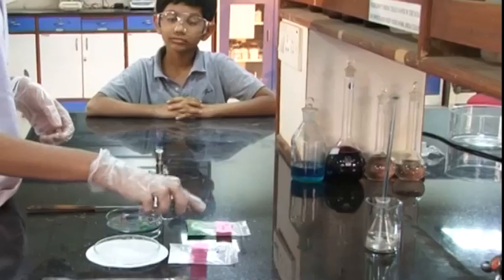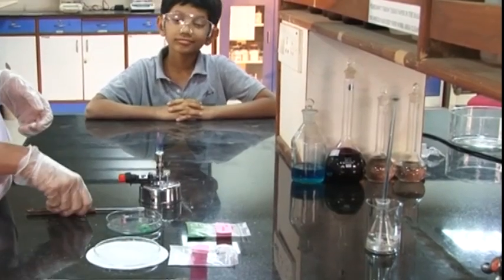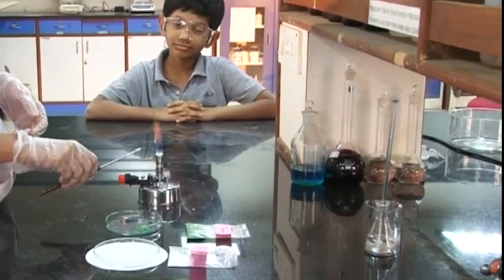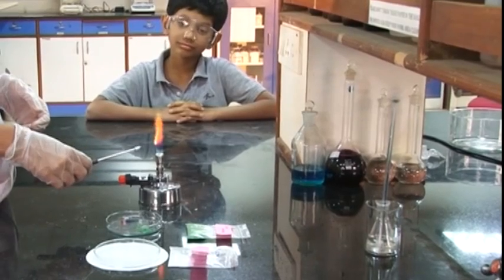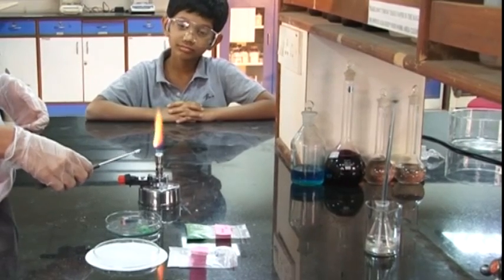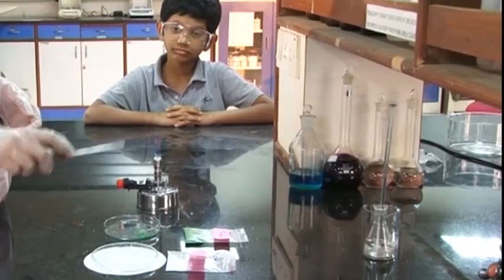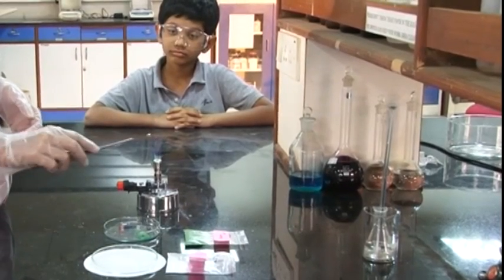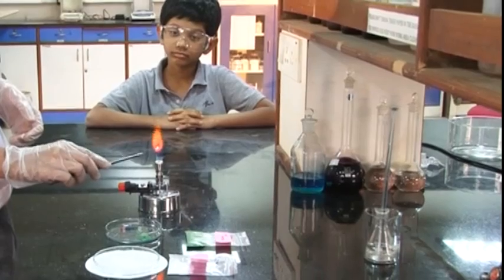Vivek, the test for colored salts is a little different. We have cupric chloride and borax. We heat the platinum wire till it becomes red hot, then dip it in borax and heat it again till it becomes transparent.